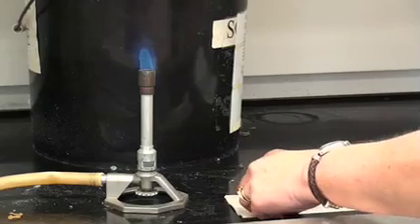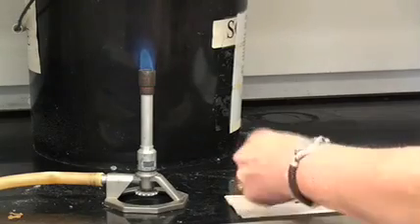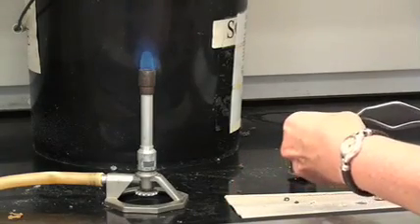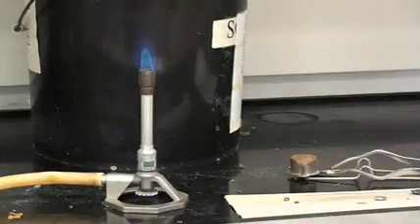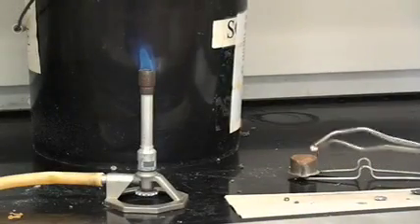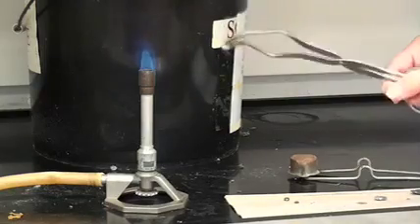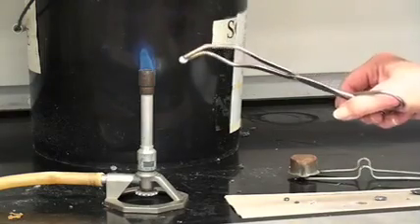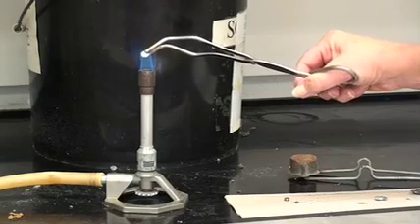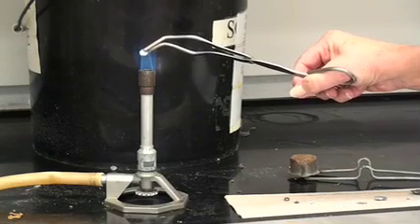Okay, so now we're going to start looking at comparing other metals in period 3 with magnesium. The first one up is aluminum. You'll notice that this guy actually looks more shiny to begin with, but let's see what happens as we put him in the flame.